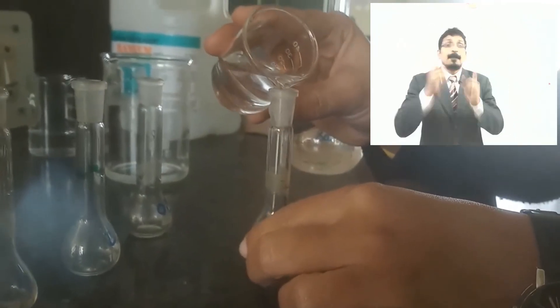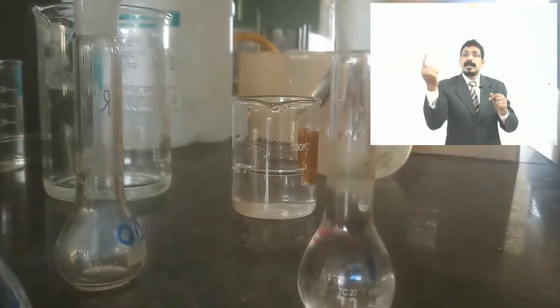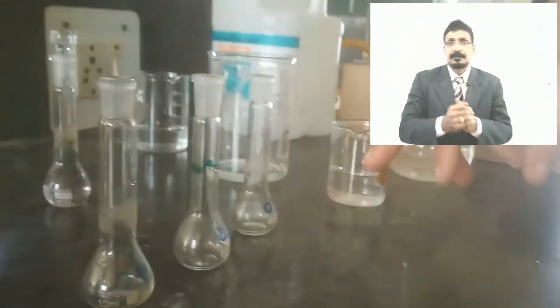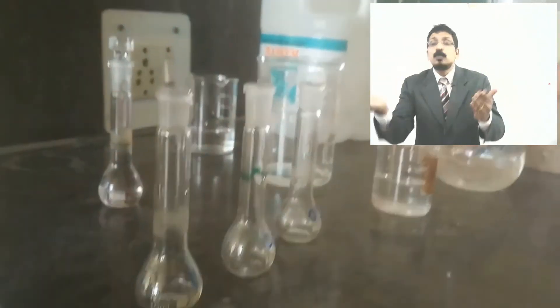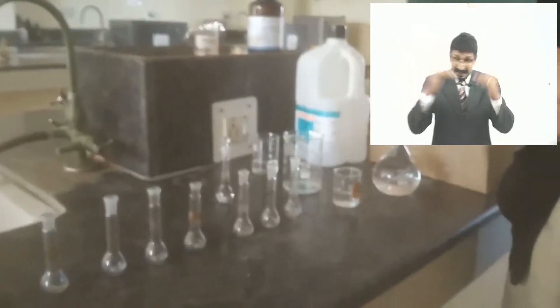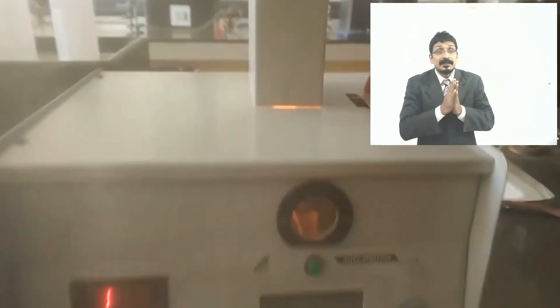From that solution: 1 mL contains 1 mg. Dilute 1 mL to 100 mL — you get 10 µg/mL concentration. Take 2 mL and make up the volume to 100 mL — you get 20 µg/mL. Take 3 mL — 30 µg/mL; 4 mL — 40 µg/mL; 5 mL — 50 µg/mL. Standard solutions are now ready.